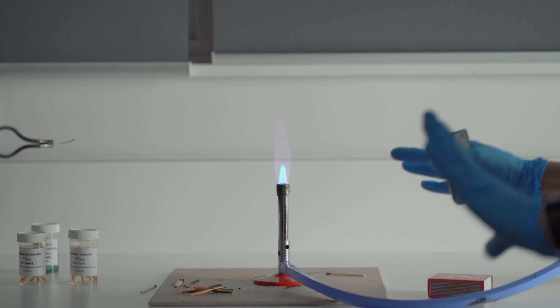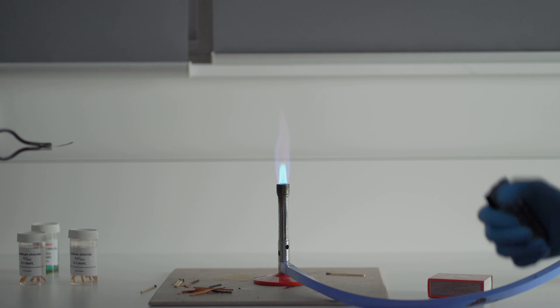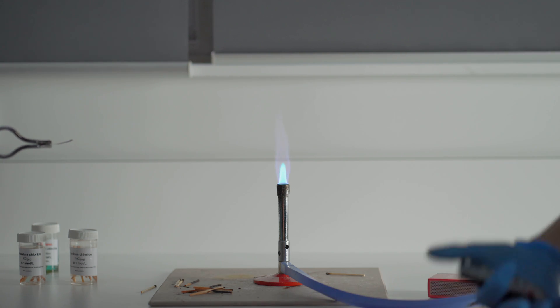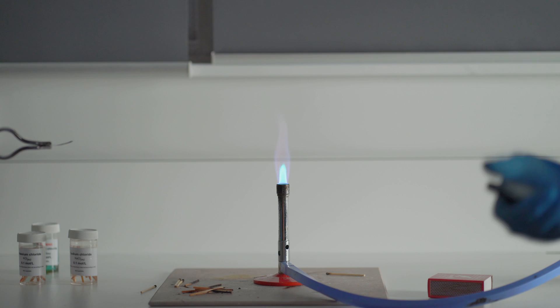I apologize if you can't see my face. I don't want to get it very close to the burner and set my hair on fire. But what we're going to look into now is what we call the flame test. Some experiments call this one the firework colors. So let's look into that.